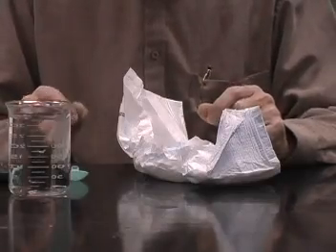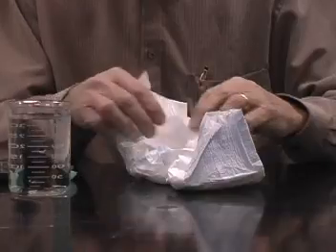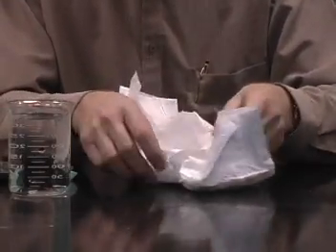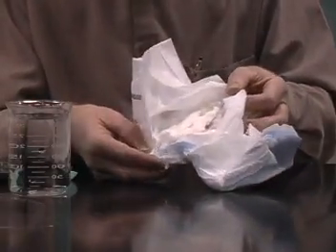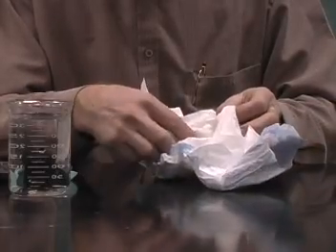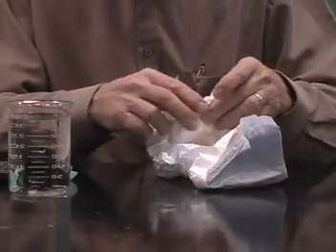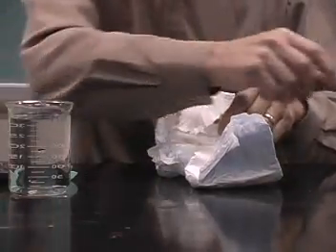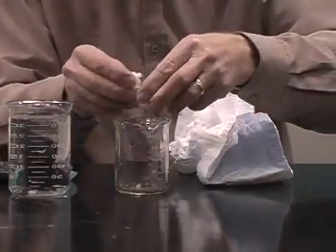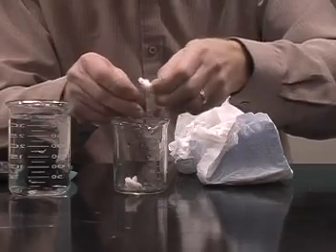Sodium polyacrylate is also one of the chemicals that is used in diapers. If we take a diaper and pull it apart, we find here a material which is rather absorbent. We'll tear that up and put it into a beaker.